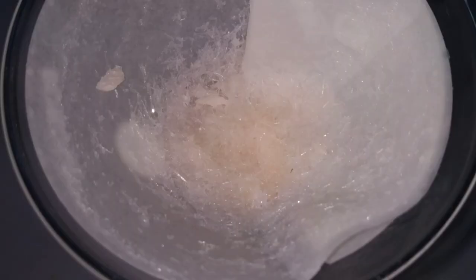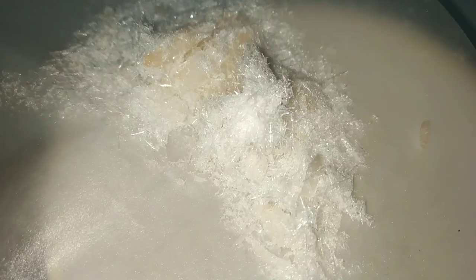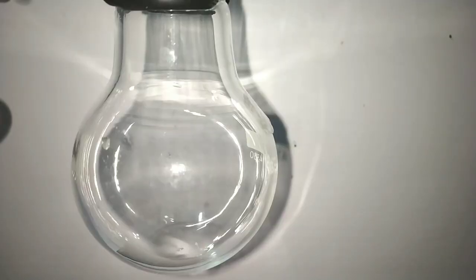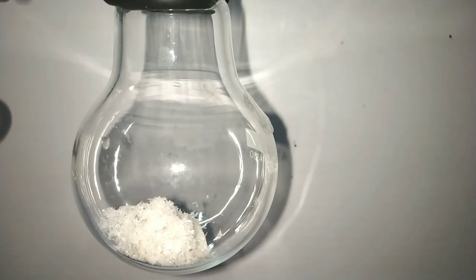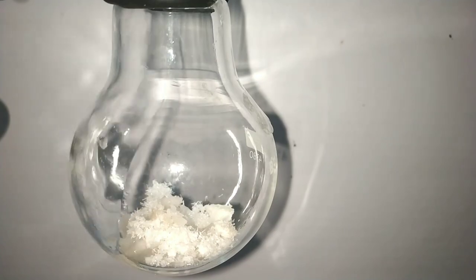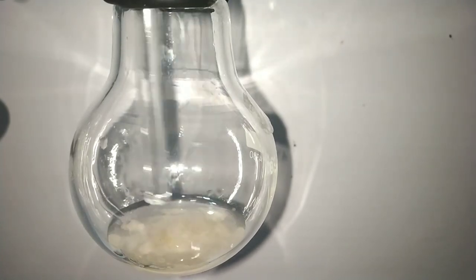After filtration we have the crude product, cyclohexanone oxime. I decided to recrystallize the compound for a much purer product. For that, I transferred the crude cyclohexanone oxime into a 100 ml round bottom flask and added about 25 ml of ethyl alcohol. Cyclohexanone oxime is very well soluble in alcohol.